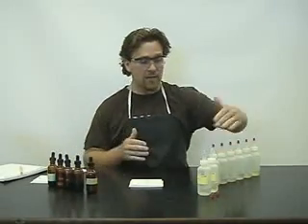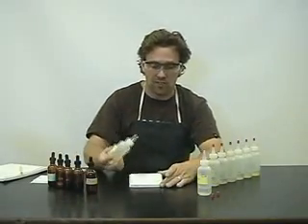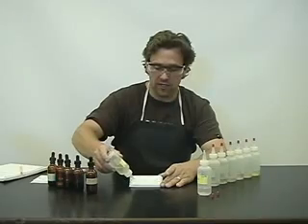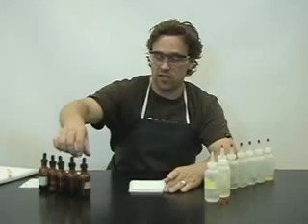So those are the colors the indicators show in the presence of a strong acid. Now remember — if all of your unknown acids show the same color as the HCl, that means the acid is stronger than the indicator. So let's do the same for the base. We'll use sodium hydroxide — we know it's going to be the weakest acid because it's a strong base. We're going to add a bit of the base into each of the spot plates and add each indicator to see the color.